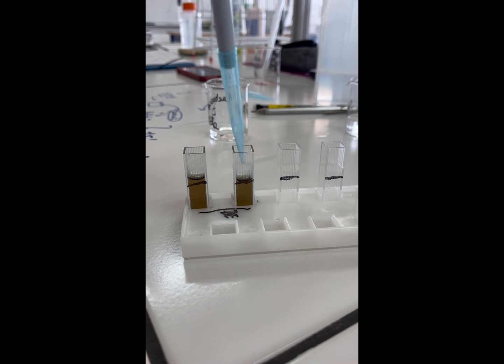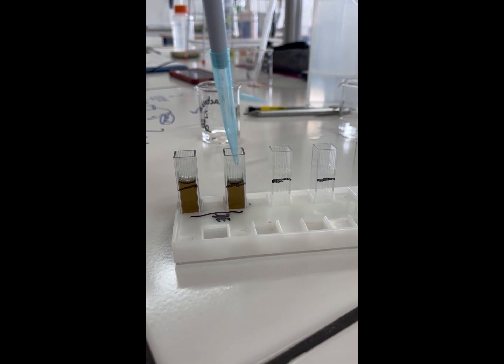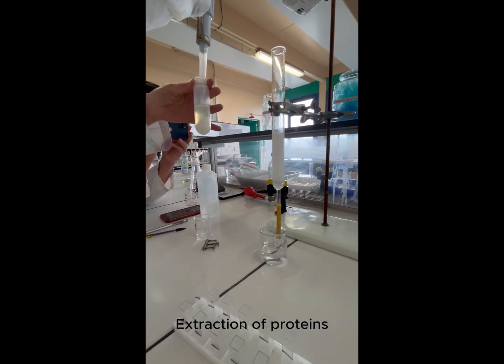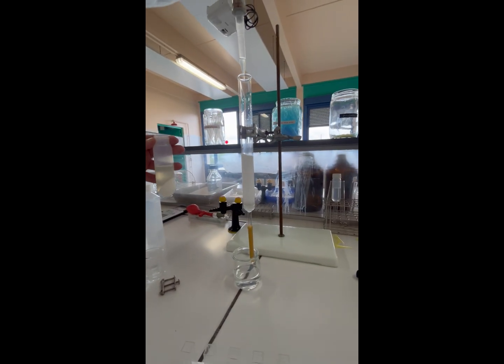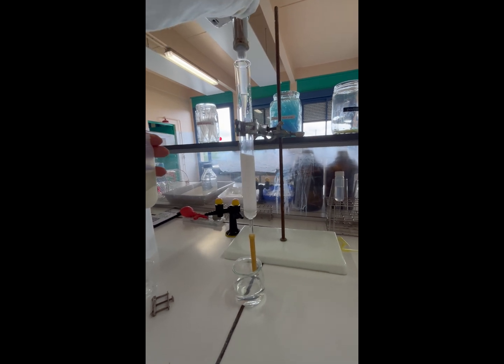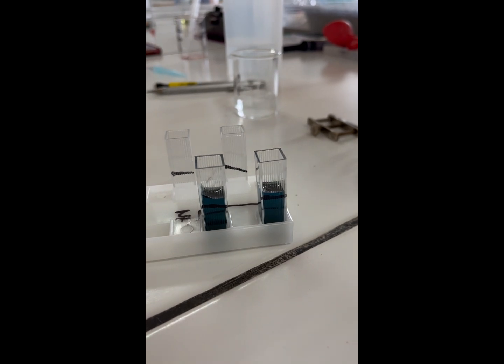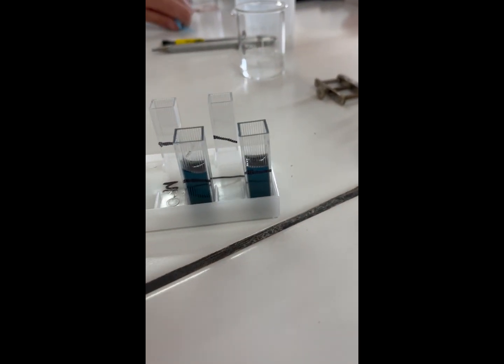We make 2 tubes with supernatant and Bradford solution. We measure the absorbance, we make a plot of the absorbance as a function of the mass of BSA and take the equation of the line. We redo the column with the supernatant where we recover the 20 tubes, but we keep only the one where the volume is equivalent to the void volume.